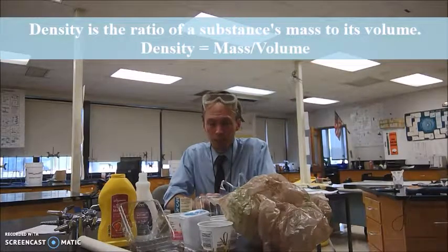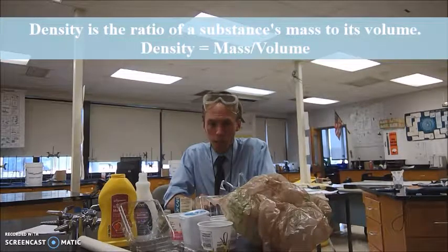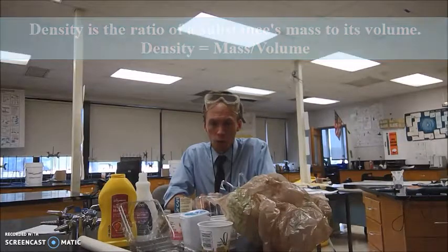However, this will be different than that lab, in that I'm not going to have you measure mass and volume directly to get density. The only thing you'll be allowed to use are four different mixtures to help you determine the density of each plastic. So let's take a look.